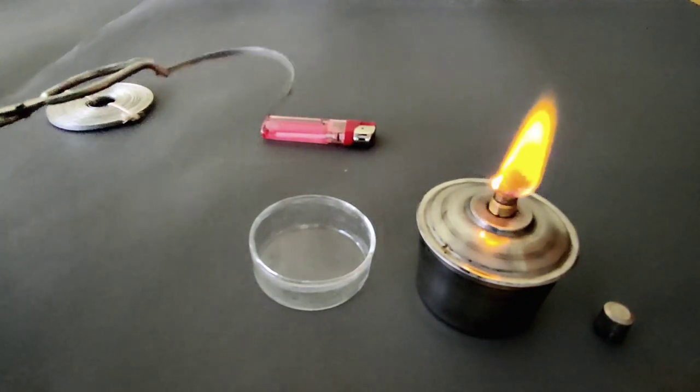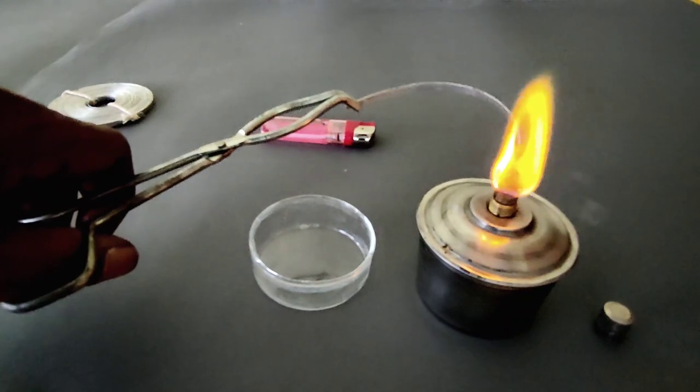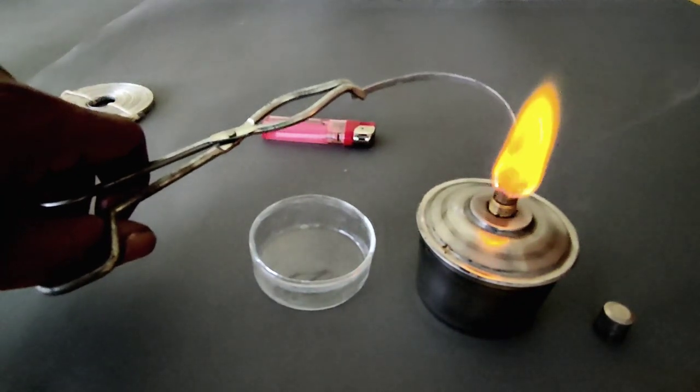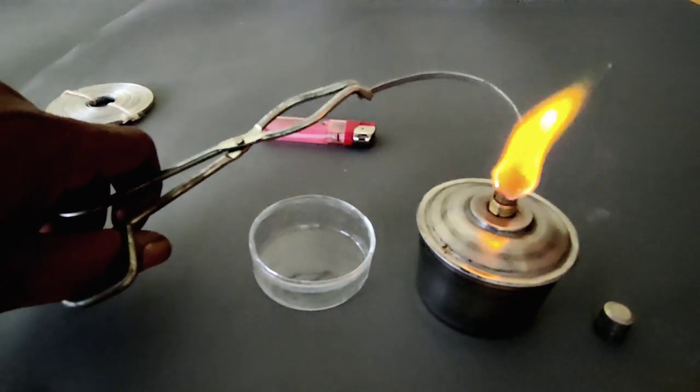Hold it with a pair of tongs and burn it with the spirit lamp. What do you observe?